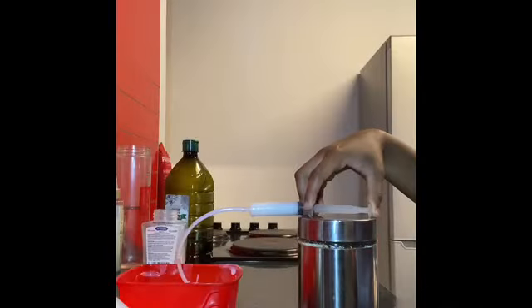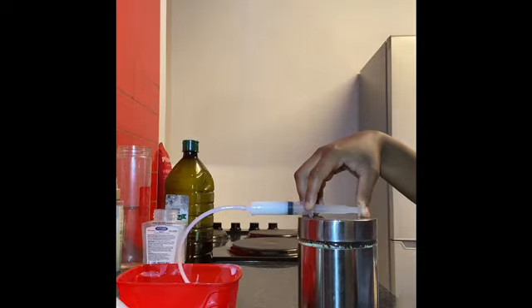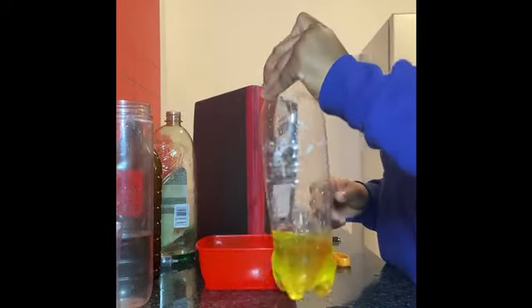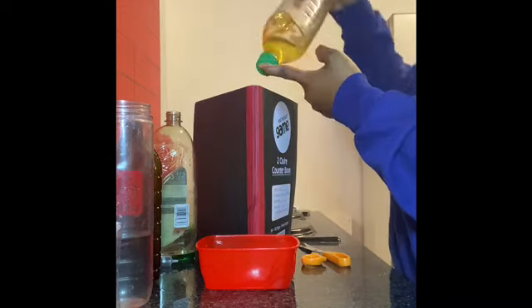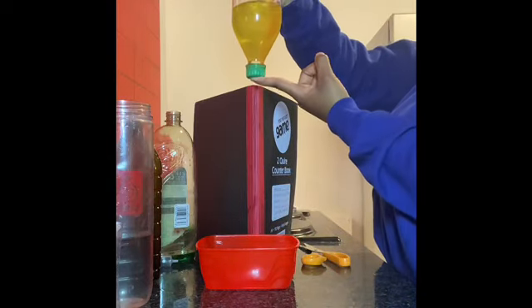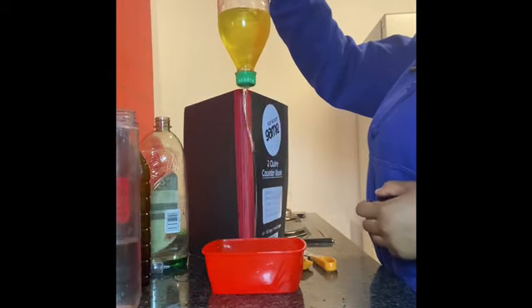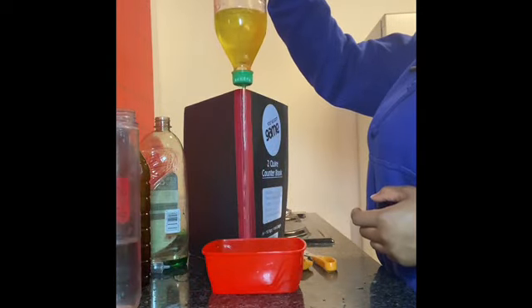The results obtained indicate that the densities of the fluids were higher during the night and lower during the day. This supports the relationship between viscosity, temperature, and density. The relationship states that a decrease in temperature will result in an increase in viscosity and an increase in density.